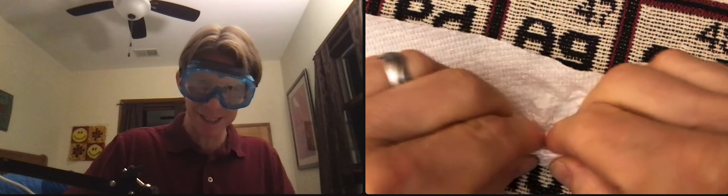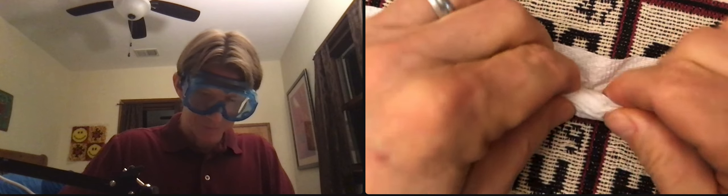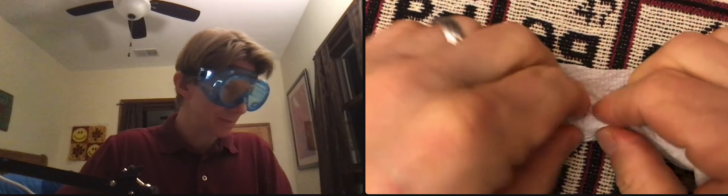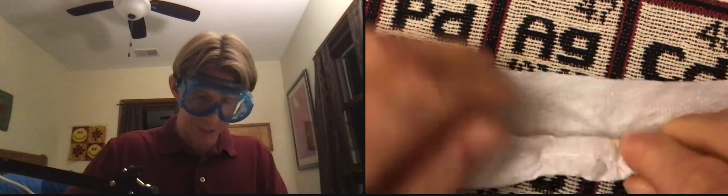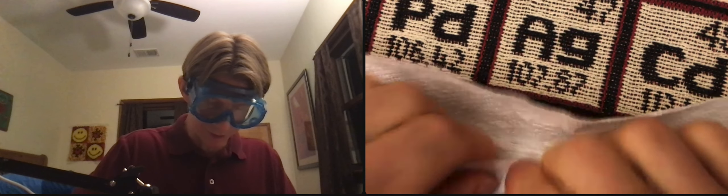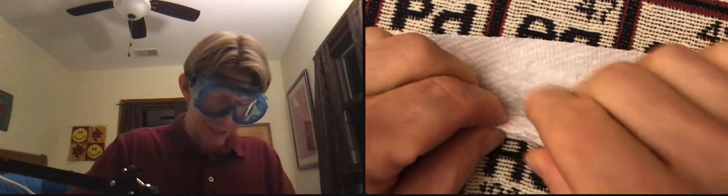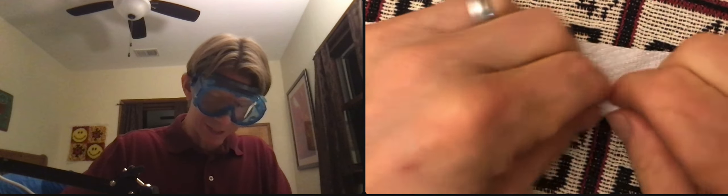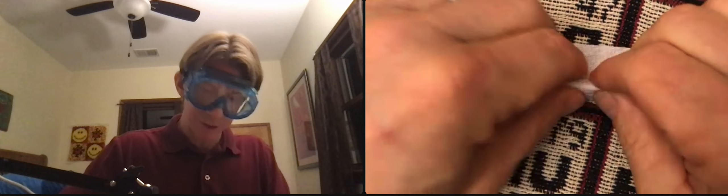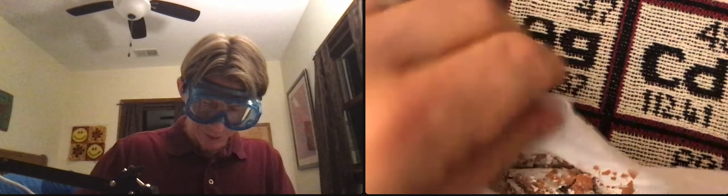As I was prepping for this, I did find a couple pieces of plastic from previous labs around my workspace. Let's see how we're doing - not too bad. I still got some pieces over there I didn't really get. Like it says in the lab, the more you do of this, the better your experience will be later, maybe faster too.